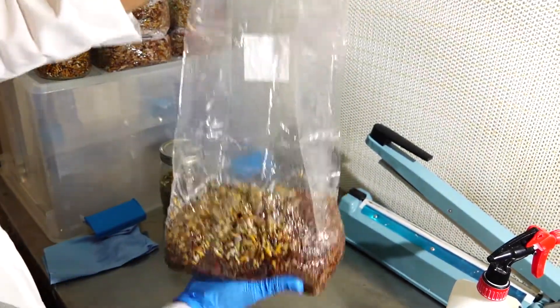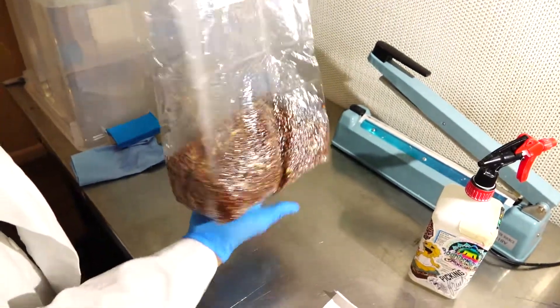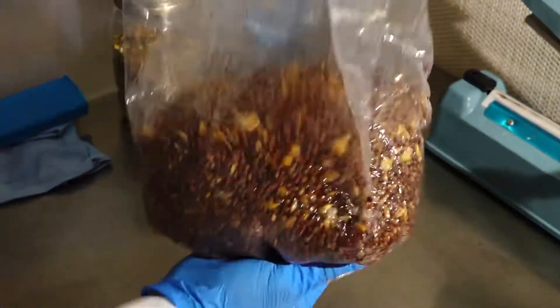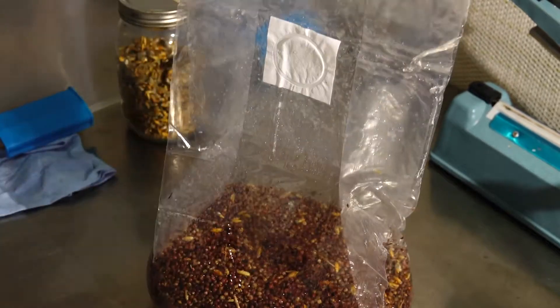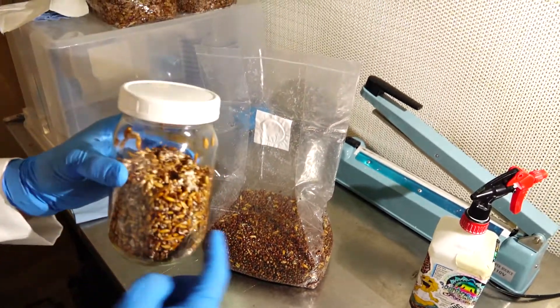Once again, I will take the whole bag and I will toss it around trying to distribute the mycelium as best as I can. And just like that, we've completed two grain to grain transfers from a jar into a bag.